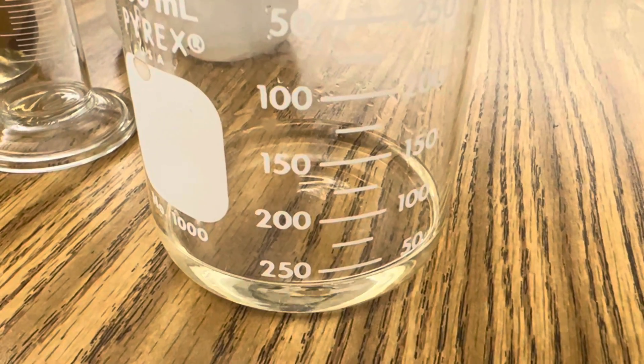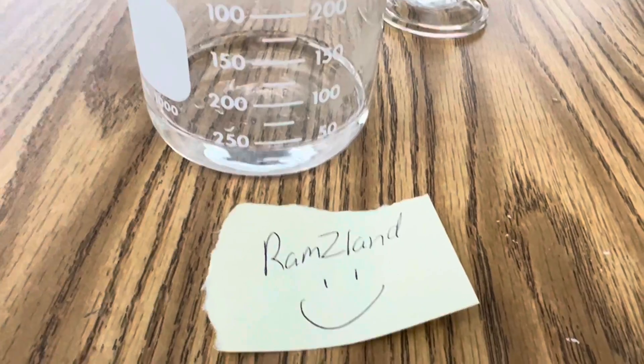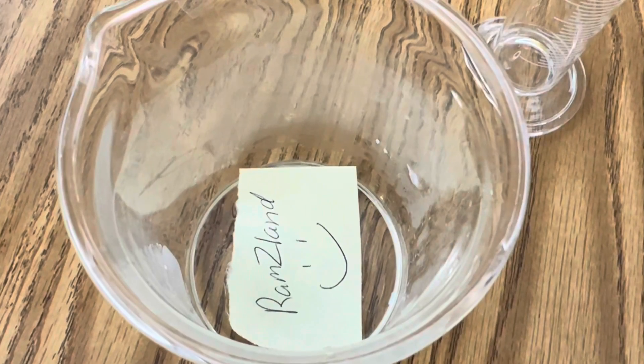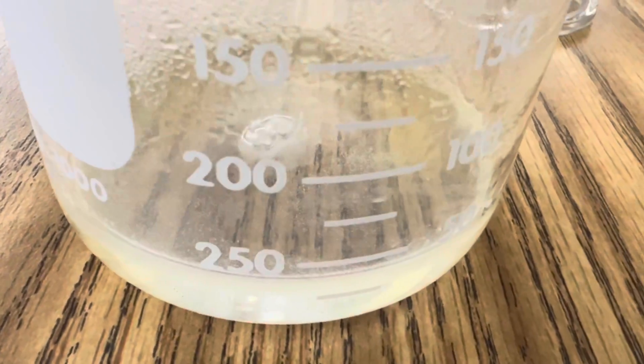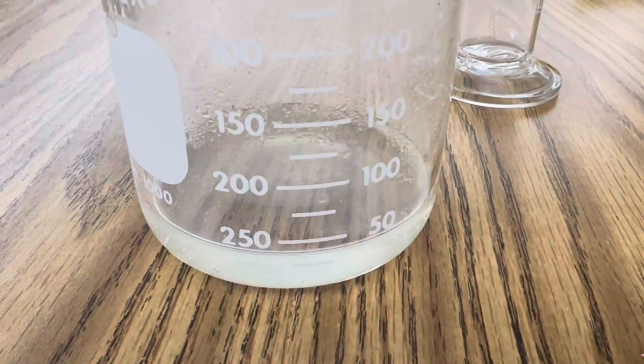You can test a small amount of paper to see how it vaporizes carbon-based products. Let's check out what happens to this piece of paper in our Piranha Solution. Immediately it starts to react. If you look at the solution, it just takes a few seconds before it becomes clear again, and the paper is completely vaporized. Just amazing. Let's test that one more time in slow motion.